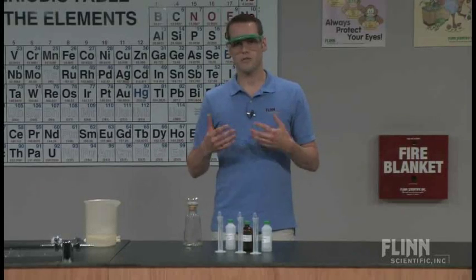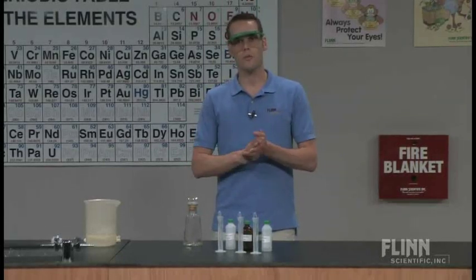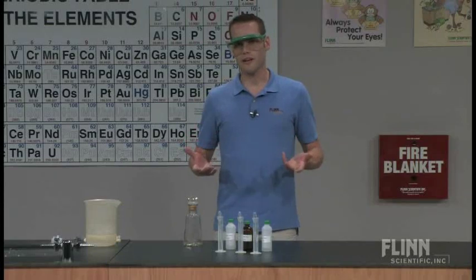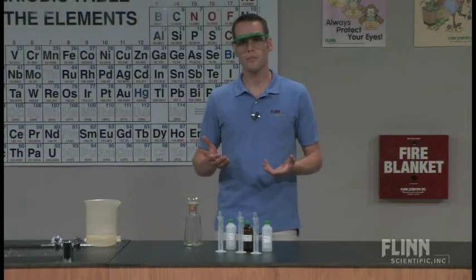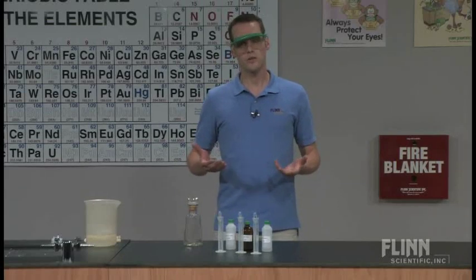After the silvering process is done, it really is a wonderful thing that they can take home with them and it's a lasting memory of something that they encountered in their chemistry class which I find really meaningful and useful. I am going to show you the process that I use in my classroom.